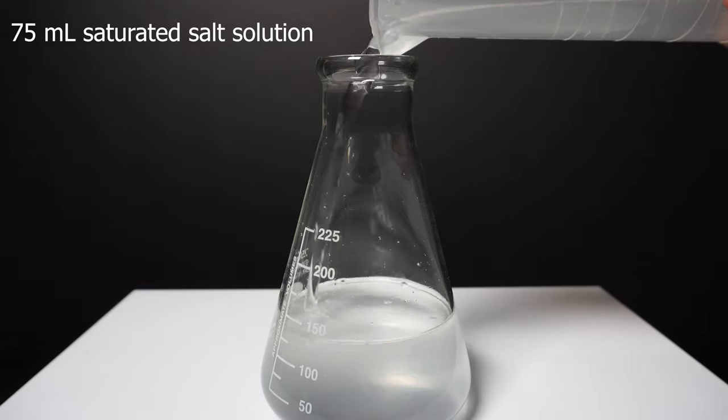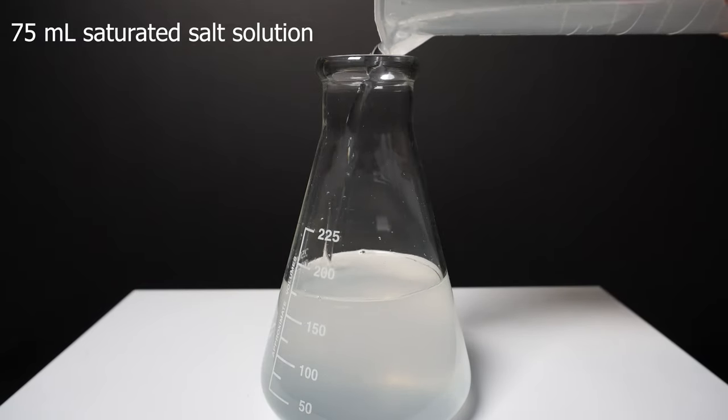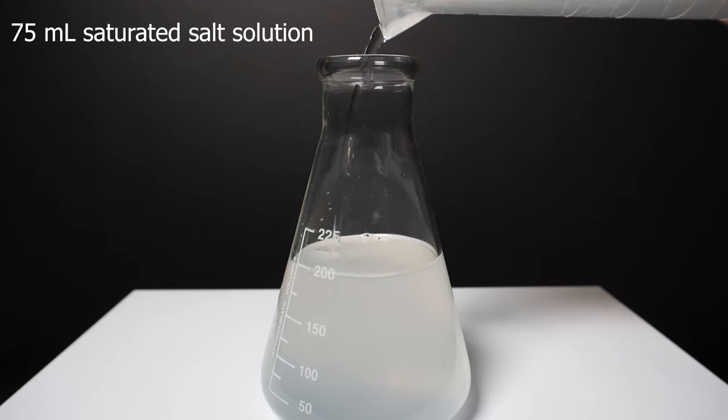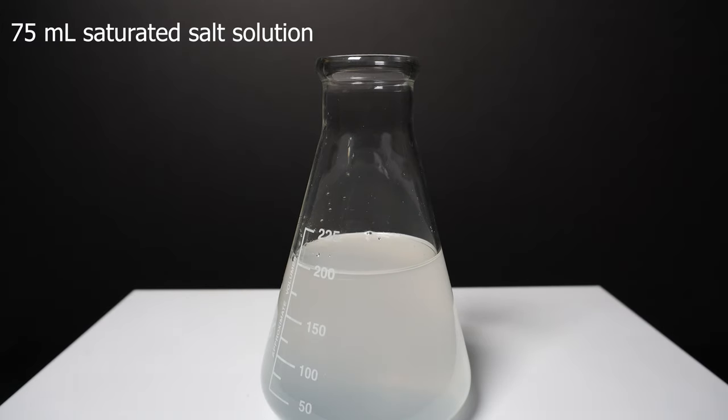First the hydrosol. I have decided to salt out the additional oil. To do this we just add a super saturated solution of sodium chloride and mix it up and let it sit for a few days.